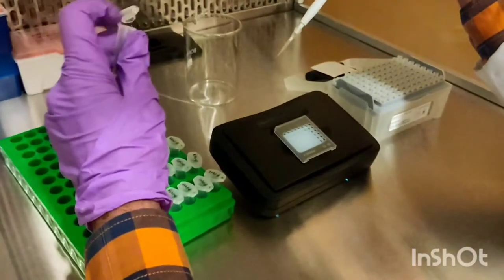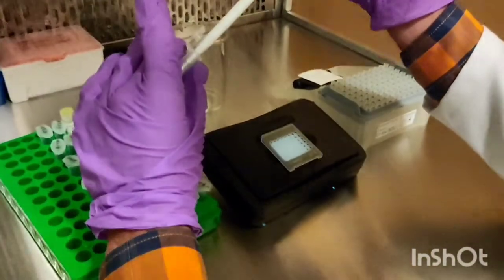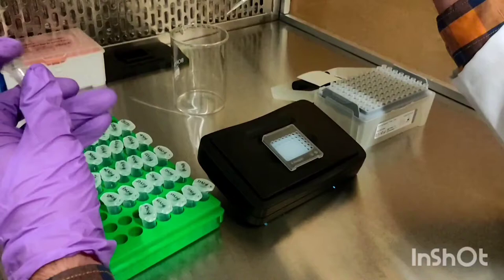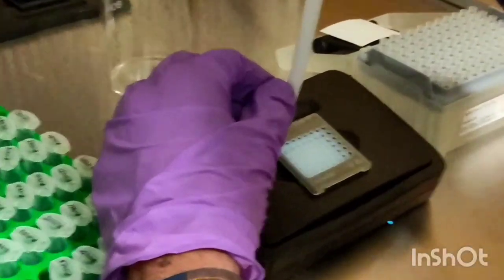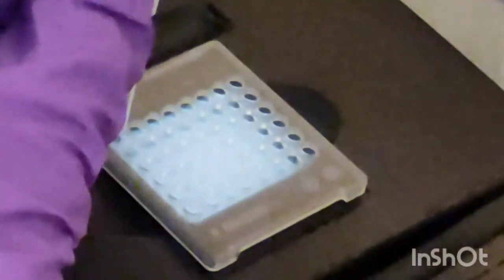And now adding the template. We already wrote the identification number in order to save the template.